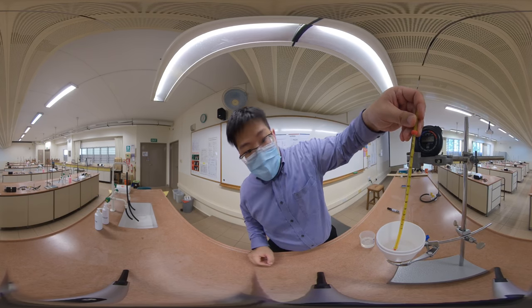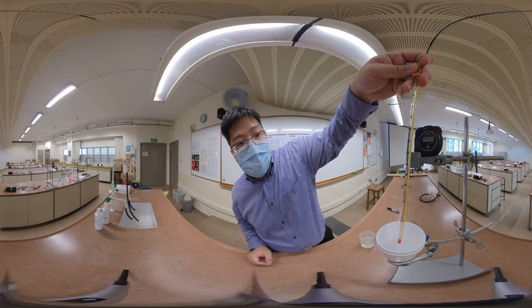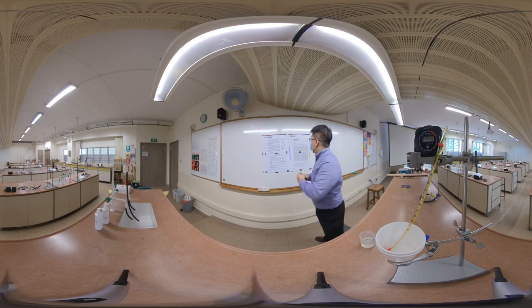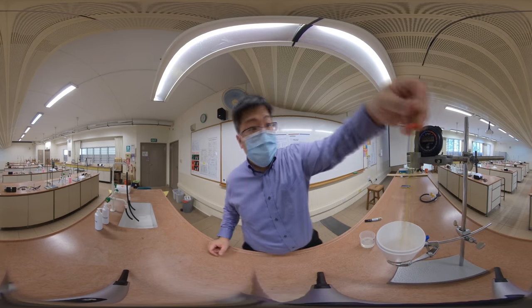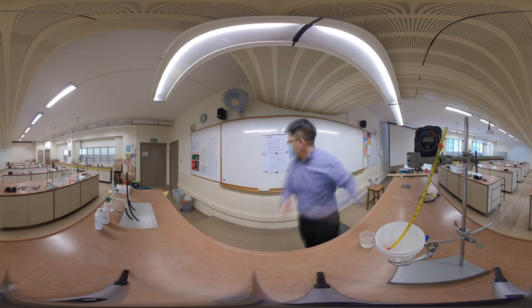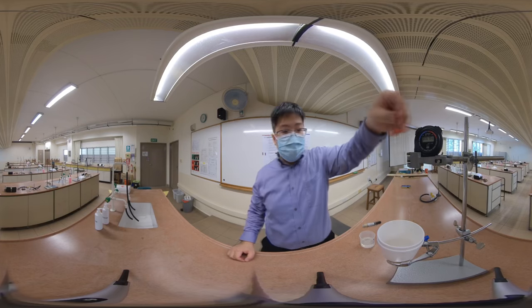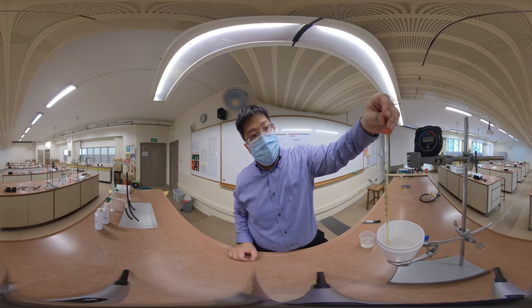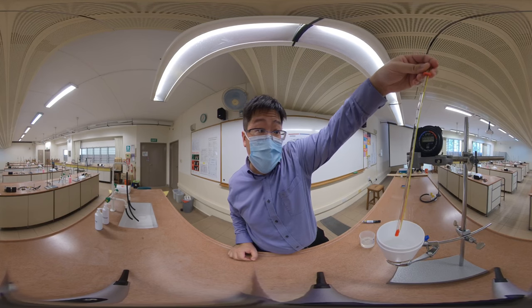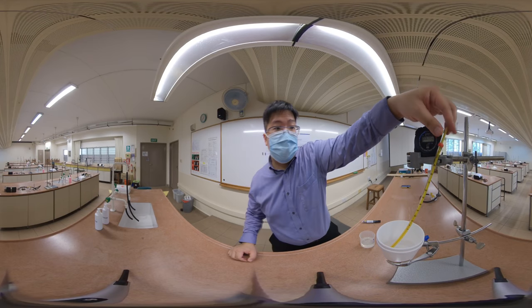At 4 minutes 30 seconds, you can quite clearly see the temperature has dropped to 26.0 degrees. I'm going to record that down. Now we have a clean 23 — I'm going to call it 23.